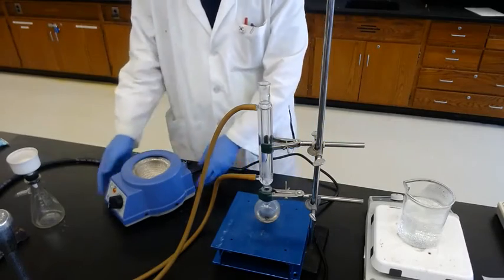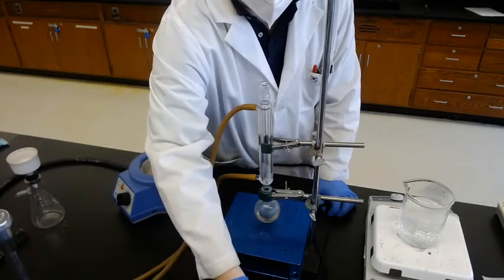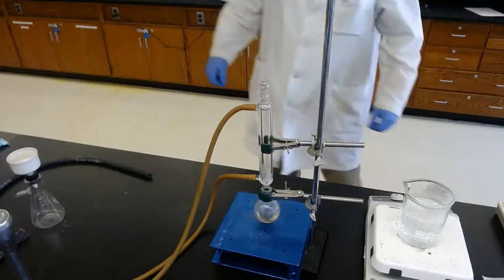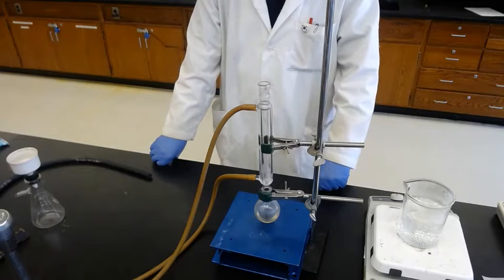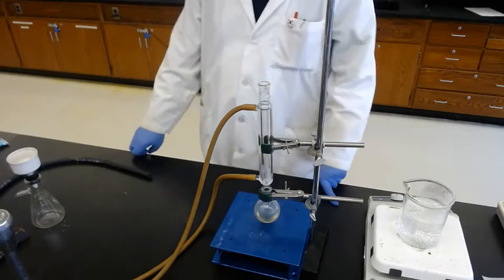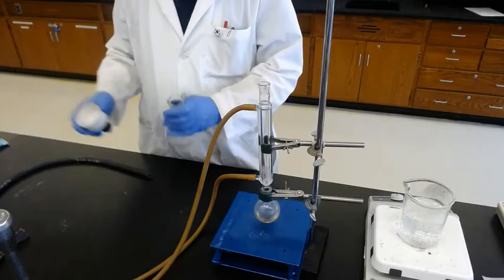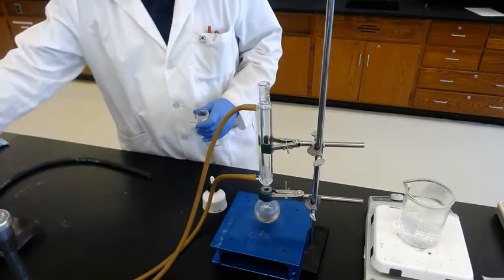And we are waiting until it's cooled down. And meanwhile, it's off. Okay, just waiting. And next, we will put it in an ice bath to precipitate more product, which is the imide compound, and then do the vacuum filtration and the recrystallization in ethanol. Vacuum filtration you already did before, but you need a Buchner funnel and suction flask. This is the combination. And while we are waiting, I'll show you how to set up.